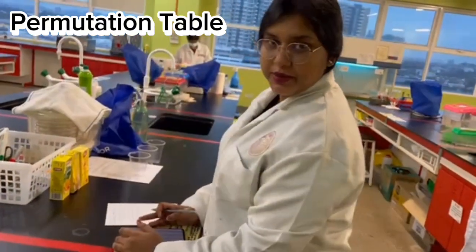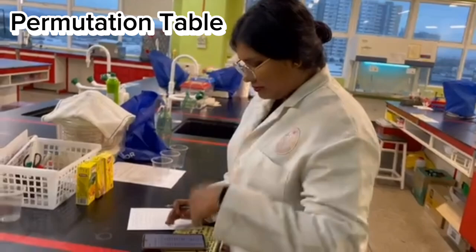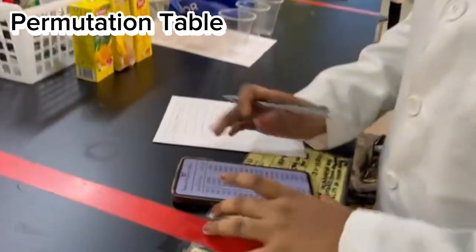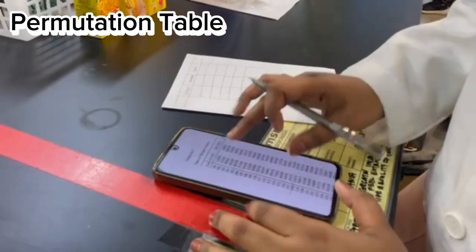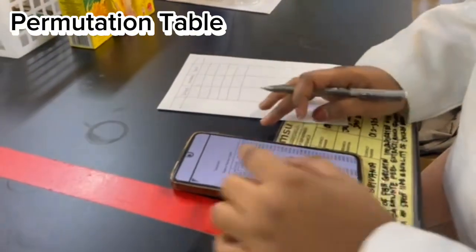So now I'm doing permutation numbering for random numbering of the samples. Come take a look at this. This is the first table that I will refer to. Since we are testing 3 samples, we will refer to the first 3.